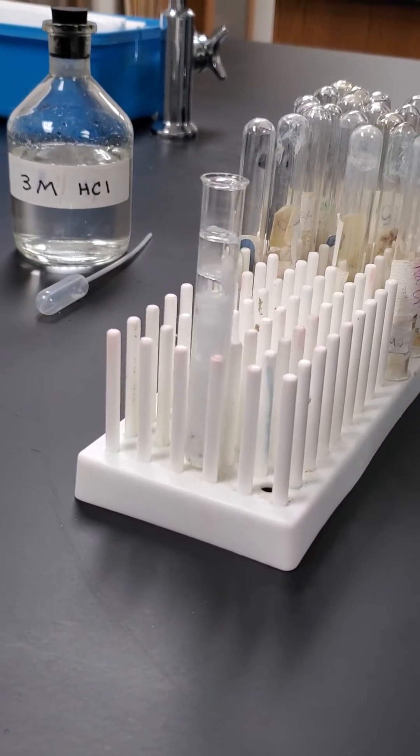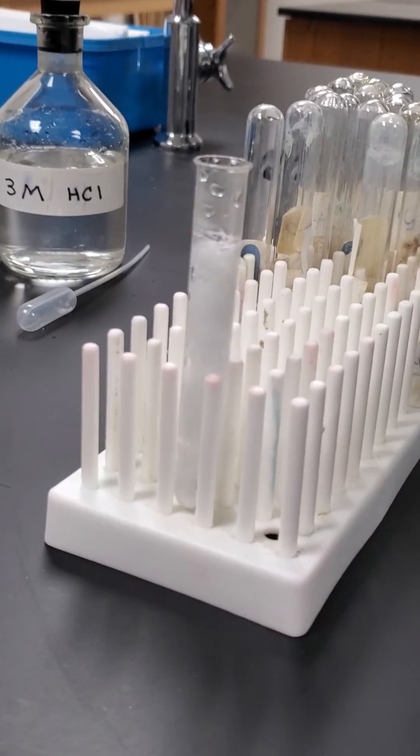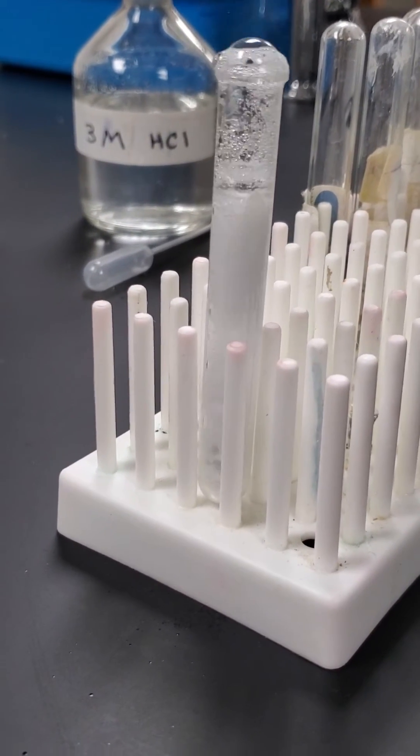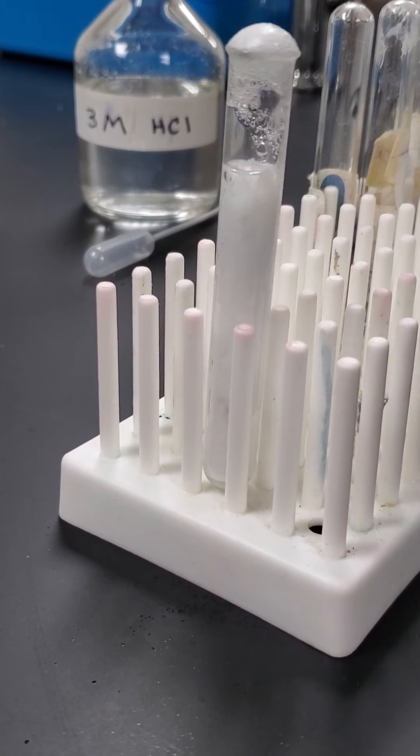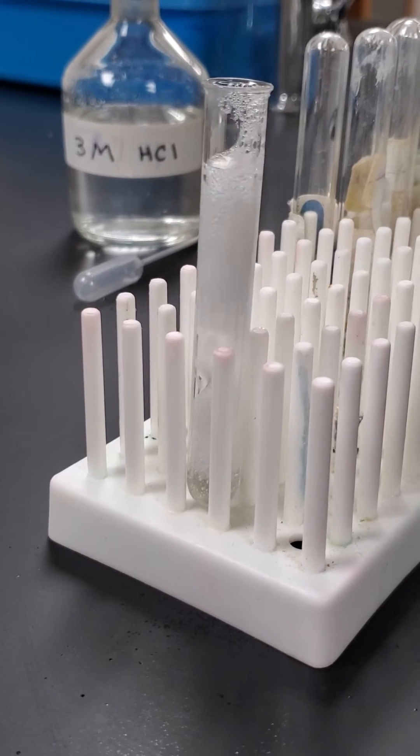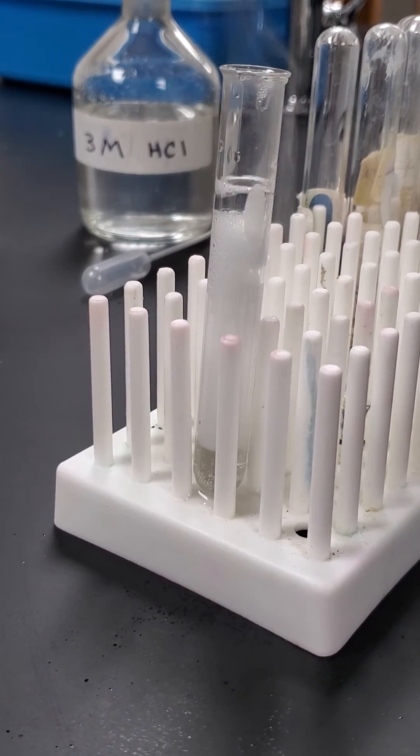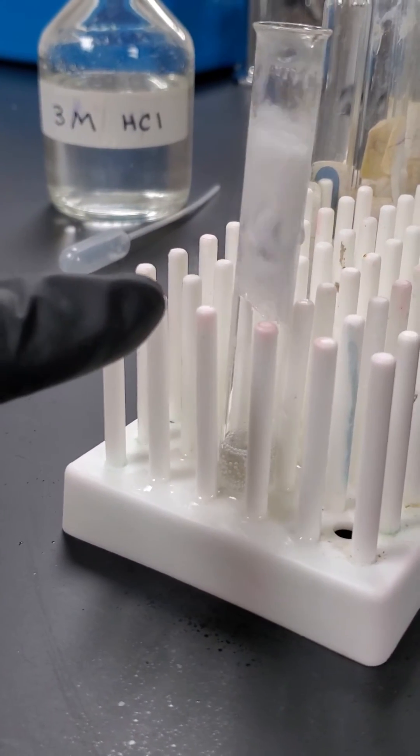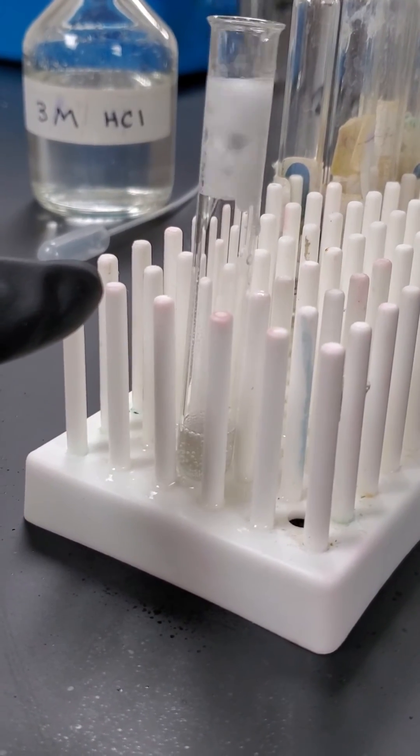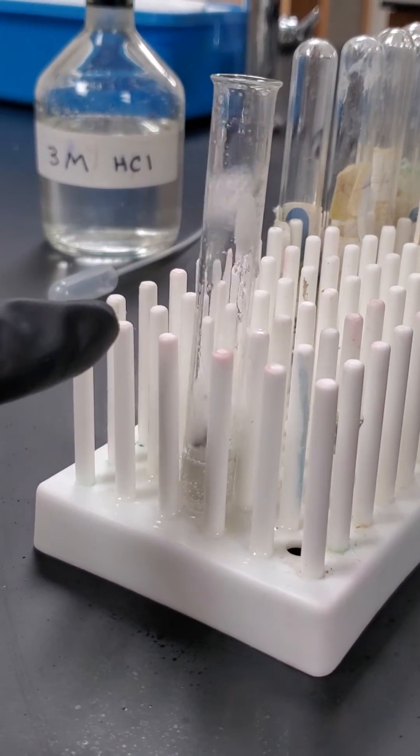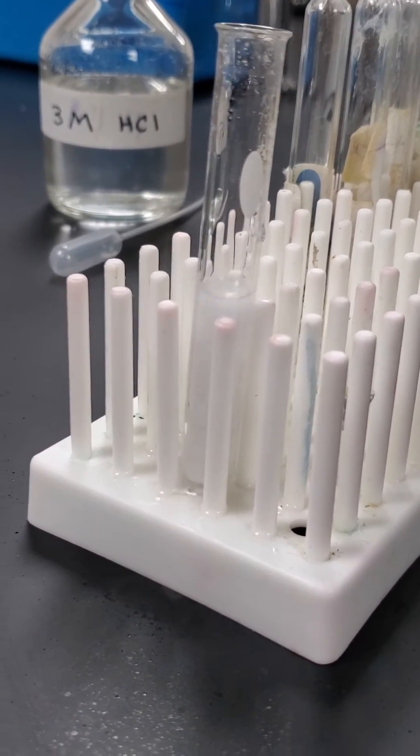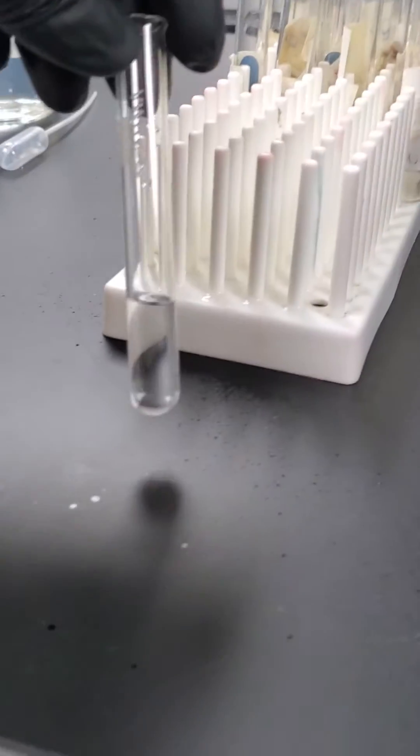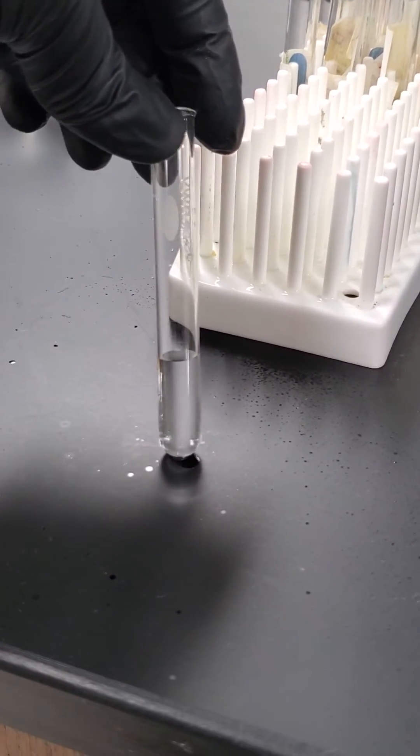Down there it's going to get pretty warm. Right now our calcium metal and hydrochloric acid are turning into calcium chloride in the bottom. Definitely lots of heat being produced. Lots of bubbles being produced. Lots of mess being made. Every once in a while you can see our calcium metal floating up towards the top. Catching all that air. And notice much smaller than it once was. We'll come back to it after it's finished. Alright so we waited a few minutes and notice now it looks very clear. Looks almost as if it is like water. But now it's a solution of calcium chloride and water.